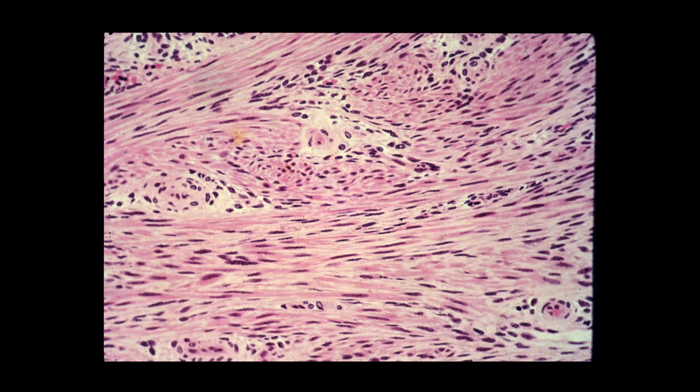You can notice in the smooth muscle individual cells that are eosinophilic staining, and within these eosinophilic staining cells you can actually see the nuclei of the smooth muscle cells. This is an appearance that's very much different from what you'd see if you were just seeing fibroblast nuclei within connective tissue. And the point that I like to make is that when you're looking at smooth muscle, the smooth muscle is much more eosinophilic in staining as compared to connective tissue.